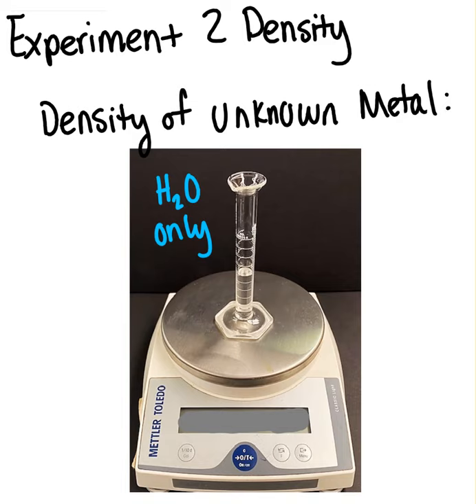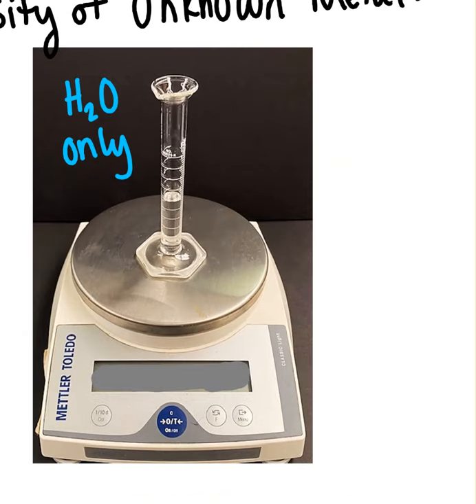So we're going to start by putting some water into our graduated cylinder, and not very full, just a little bit. And we're going to read off that volume, and that will be your data point A, and it will be in milliliters. Now when I tell you the A, you should have some numbers given to you, and A refers to a number on that sheet.